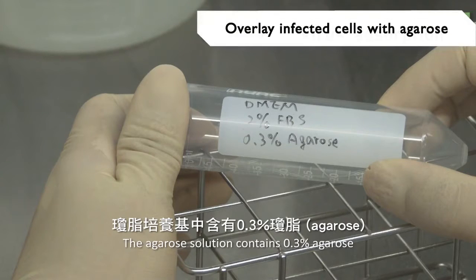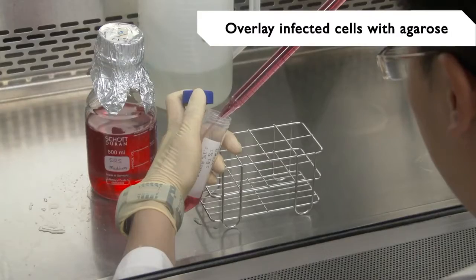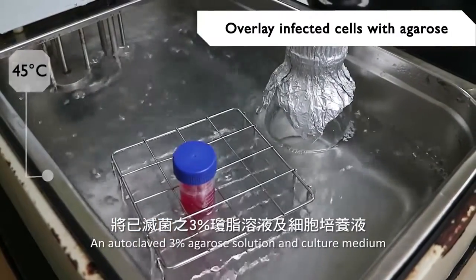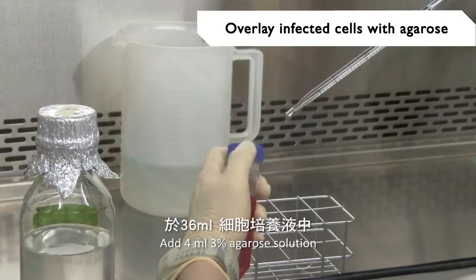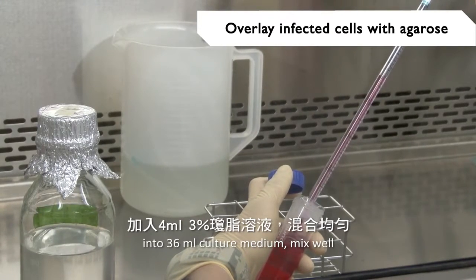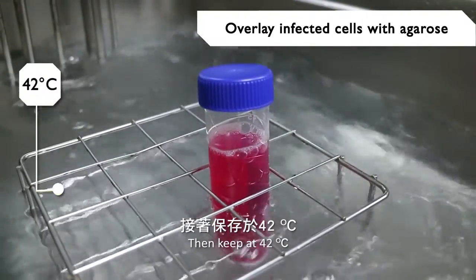The agarose solution contains 0.3% agarose and culture medium with 2% FBS. An autoclaved 3% agarose solution and culture medium are pre-warmed at 45 degrees Celsius. Add 4 ml of 3% agarose solution into 36 ml of culture medium. Mix well, then keep at 42 degrees Celsius.